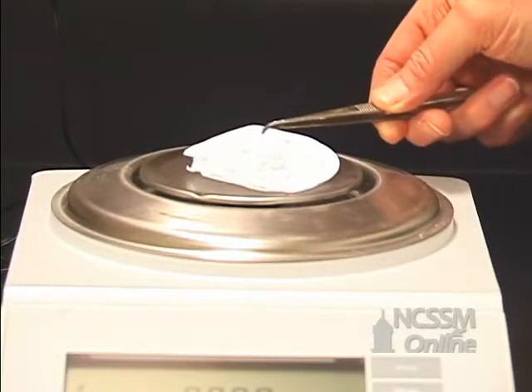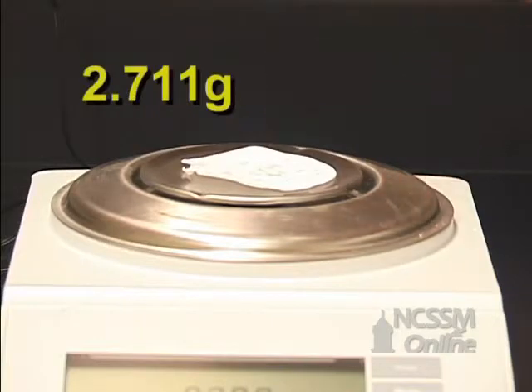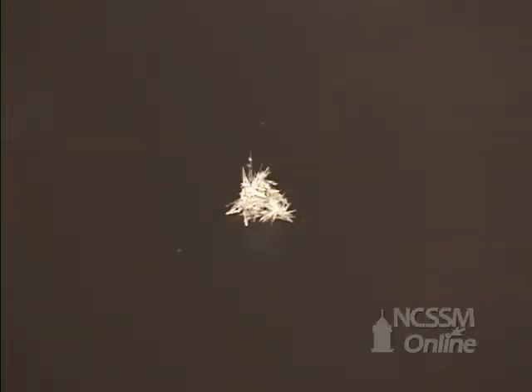Now we want to weigh our dried filter paper and aspirin sample. This is what one of the crystals up close looks like.